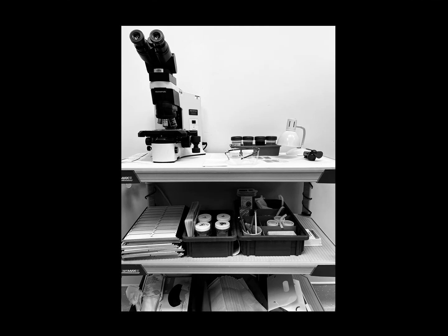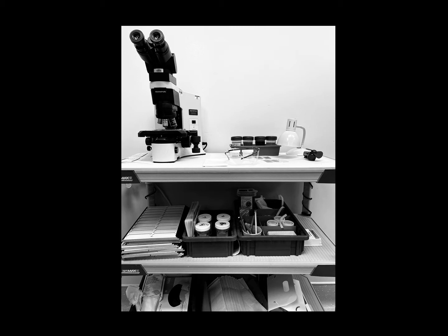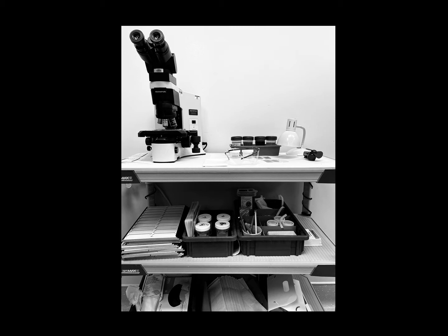This picture displays what is typically needed during rapid on-site cytology evaluation. Beside the microscope, you will need glass slides, paper towels, gloves, gown, and goggles. The staining solution should be in airtight containers. The glass slides are appropriately labeled on the frosted side with the patient's name and a second identifier, and subsequently marked with the number of the needle pass.